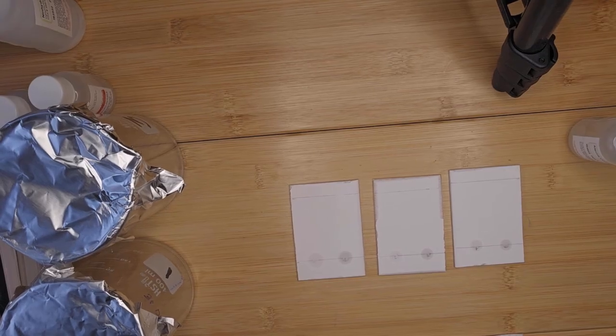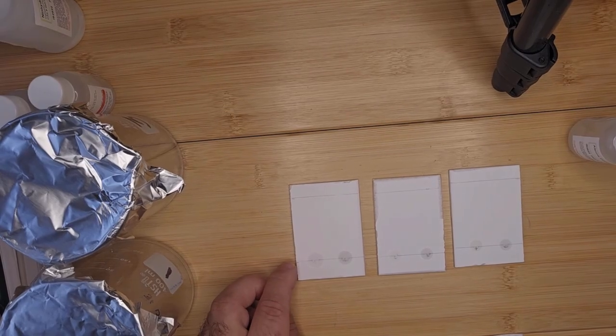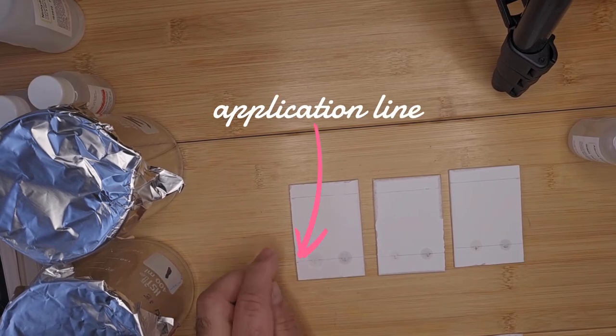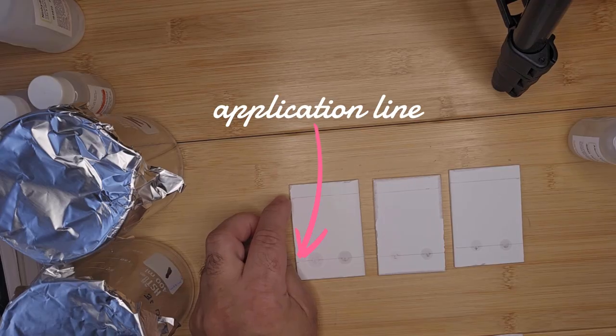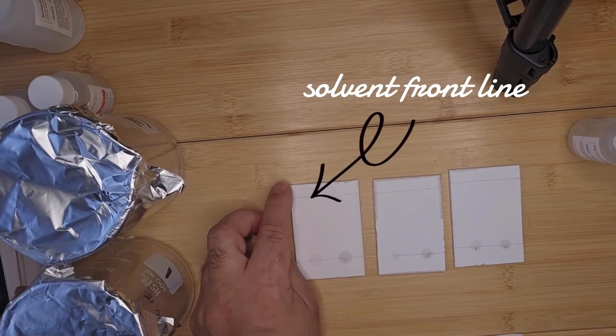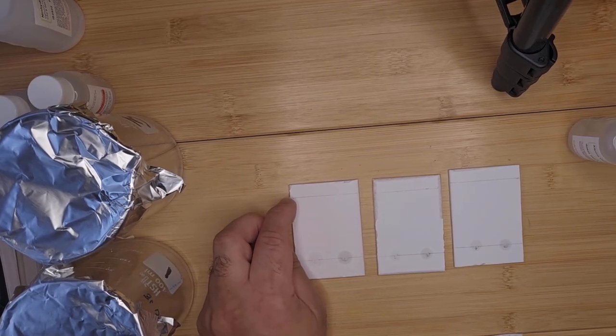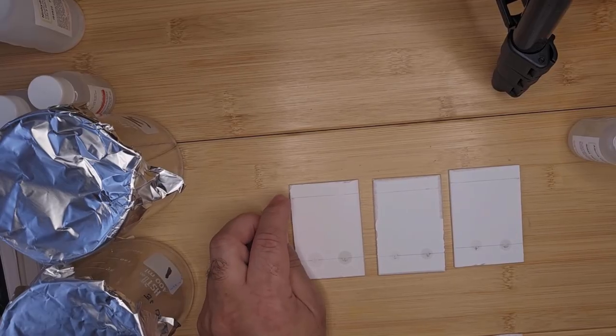Also, a very important point is when you're drawing: my application line is 2 centimeters from the bottom, and then I drew a solvent front line, which is 1 centimeter from the top. This is the line that my solvent will travel to. Once the solvent gets to my solvent line, I take the plates out of the chamber.